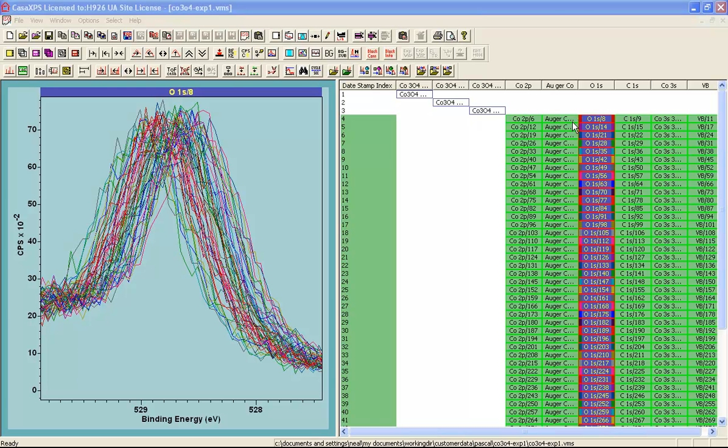So in order to process this data file so that we can sum the data bins in terms of binding energy and produce better quality spectra, what we need to do is calculate an offset for each one of these oxygen 1s spectra that will allow us to then calibrate each row in turn, and hence produce a better quality set of narrow scan spectra than we would if we simply summed these data as given. In order to calibrate on a row by row basis, we need a peak model and a component within a peak model to specify the binding energy for that peak, and that will allow us to calculate the offset.